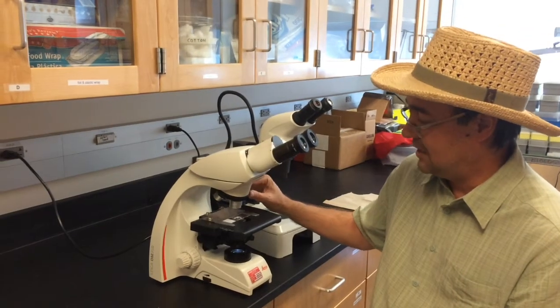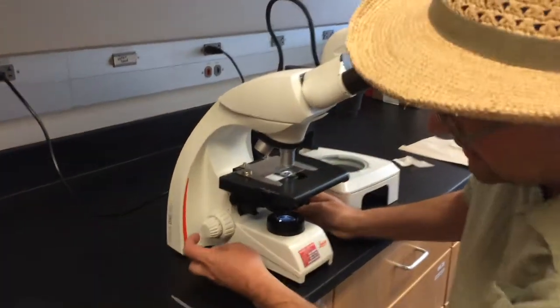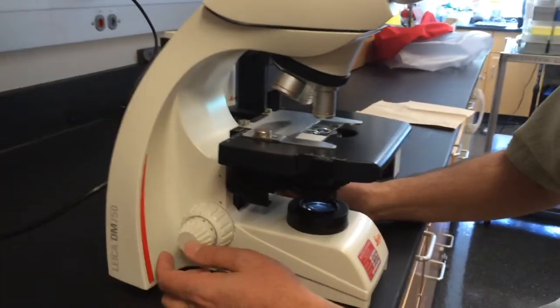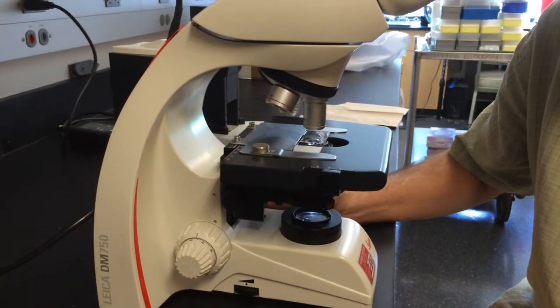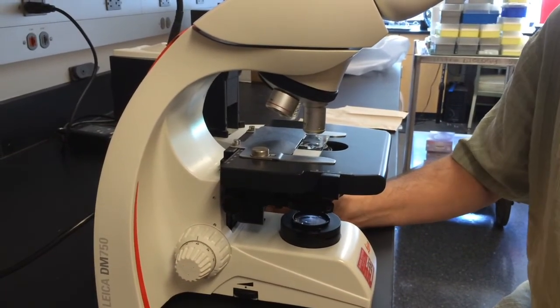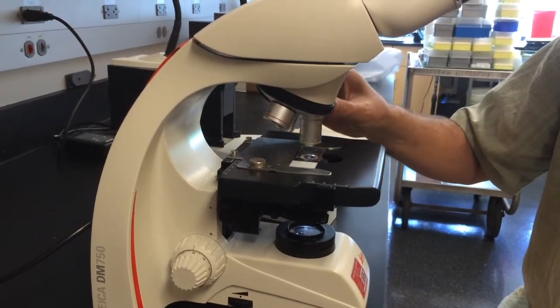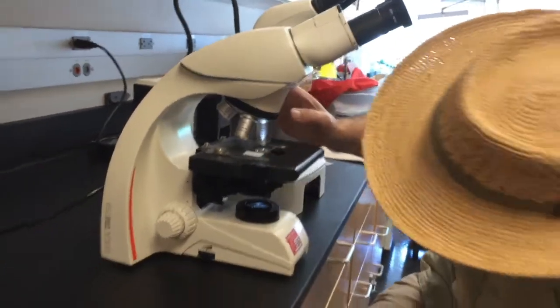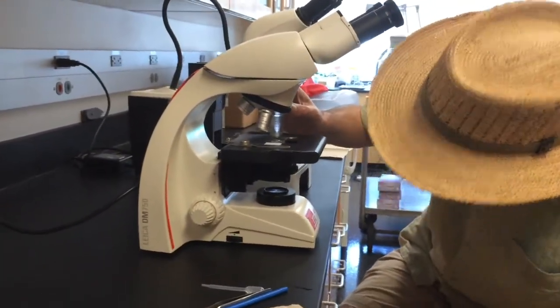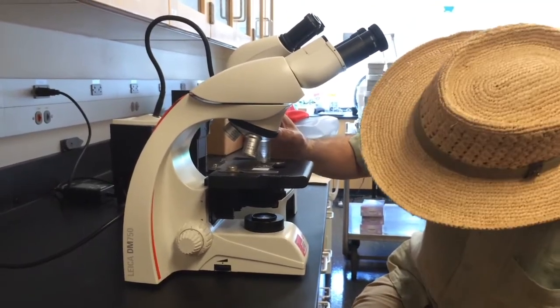So I can just rotate it up to 10x, and it's still very, very close to in focus. I can then use the fine focus, this one, the little one, and you should have to only rotate a fraction of a turn in order to get it in focus. And then after you're set with that, you can rotate it up to high power, and I'm just looking from the side here to make sure that the cover slip isn't riding on an ocean of liquid.